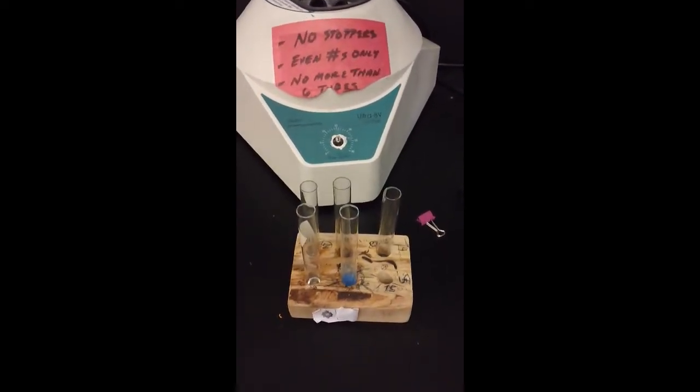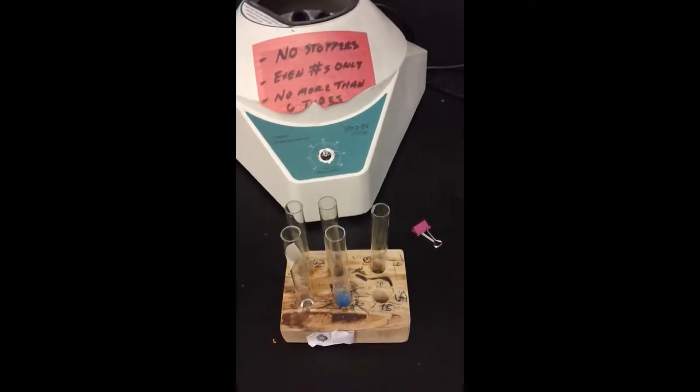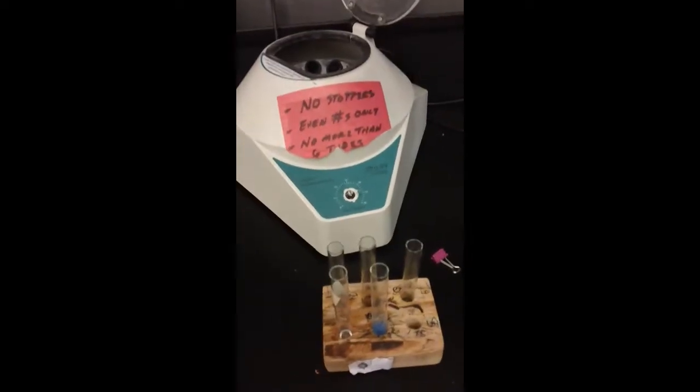Okay, welcome back to test C after centrifuging. So now we're going to take another look at our chemicals, and we're going to see if for these known 5 substances, a solid formed or is noticed after centrifuging. So this is after centrifuging, test C. So first we're going to start with our Cr.